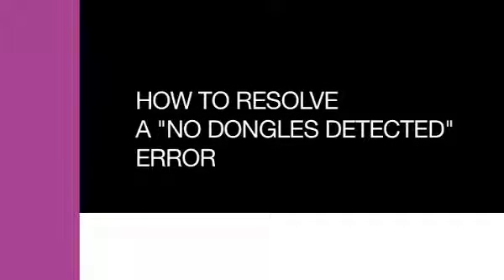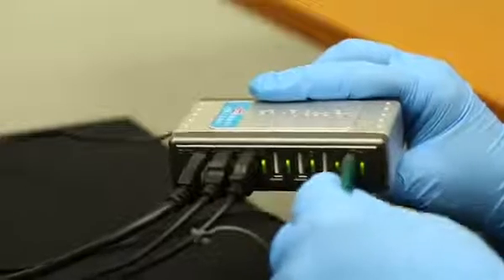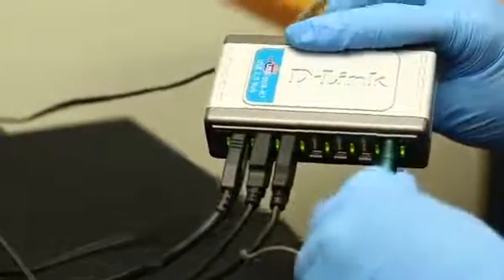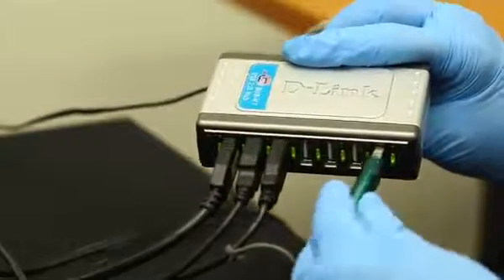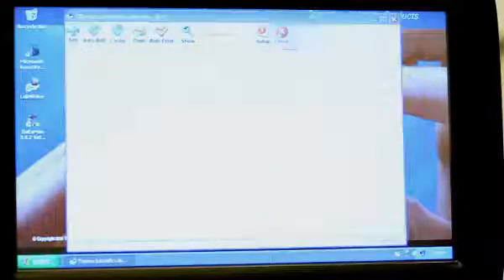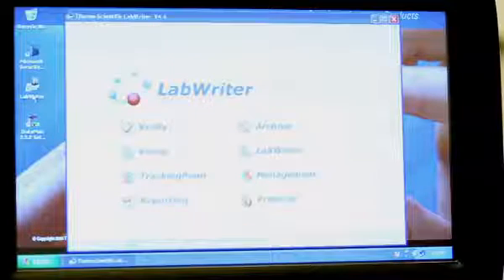How to resolve a no dongles detected error. If the dongle is not in the USB port, insert the dongle. If the dongle is inserted, pull it out of the USB port and reinsert. Close LabWriter and reopen it. This should eliminate the issue.